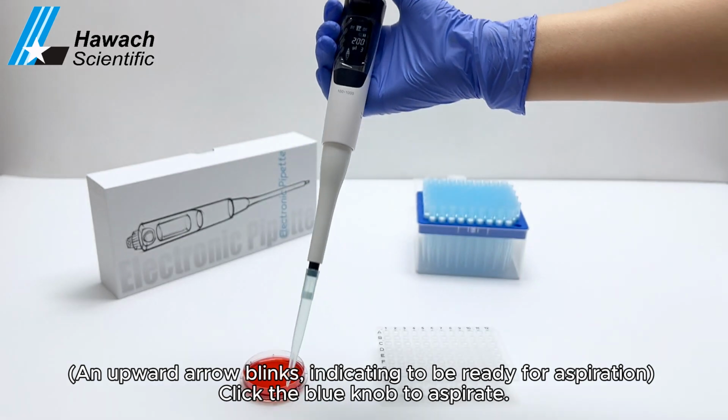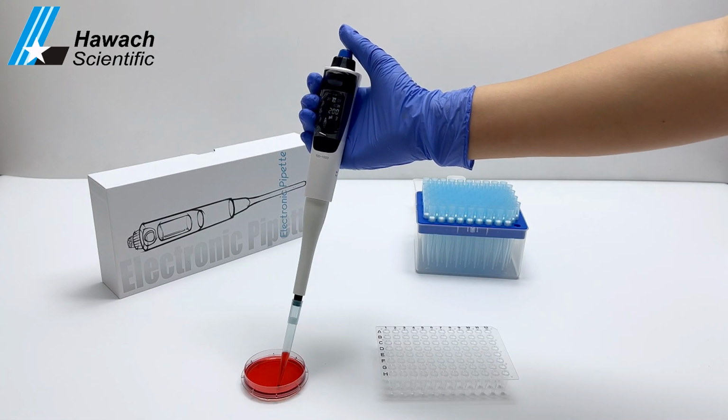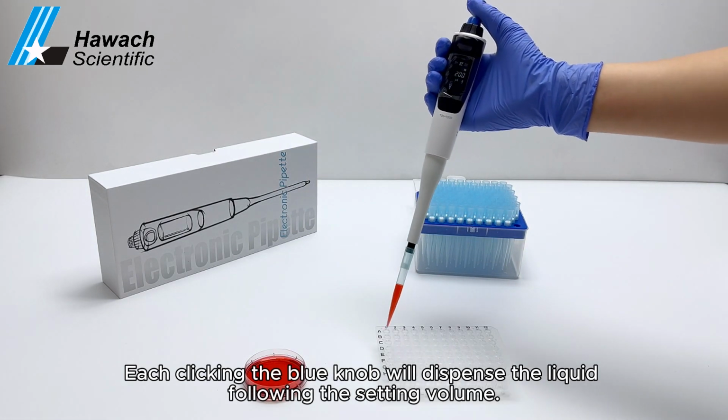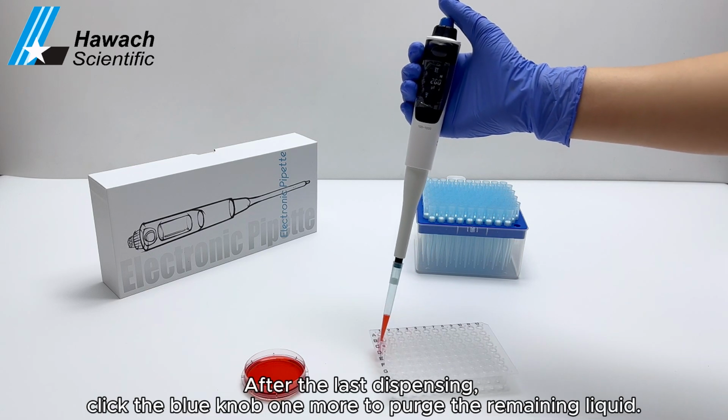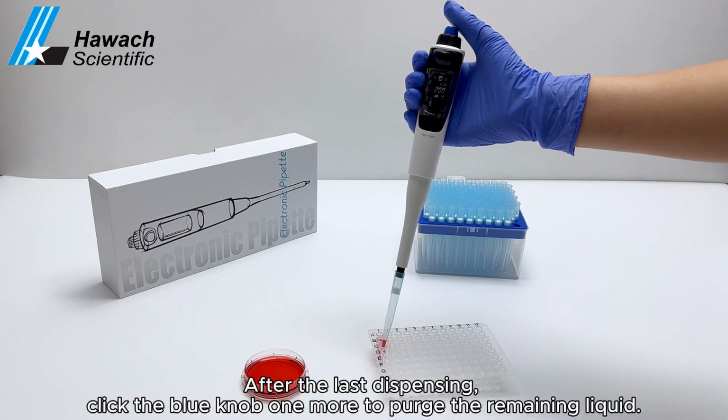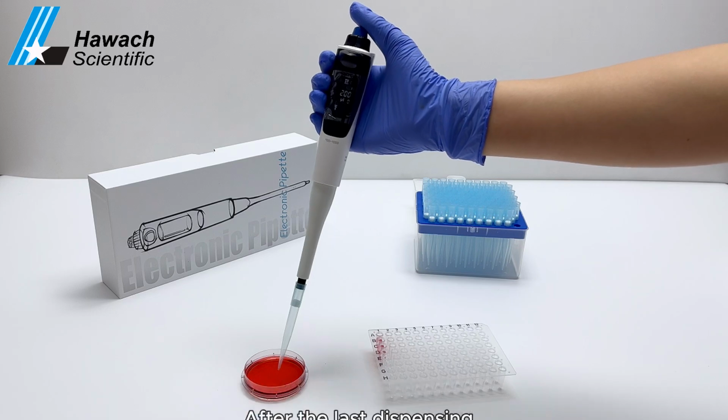Click the blue knob to aspirate. Each click of the blue knob will dispense the liquid following the set volume. After the last dispensing, click the blue knob once more to purge the remaining liquid.